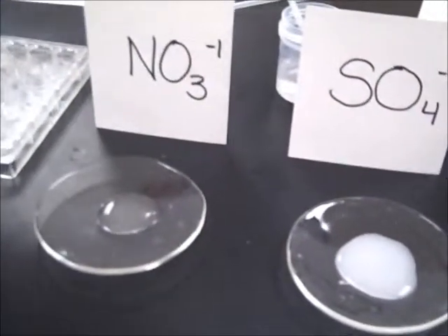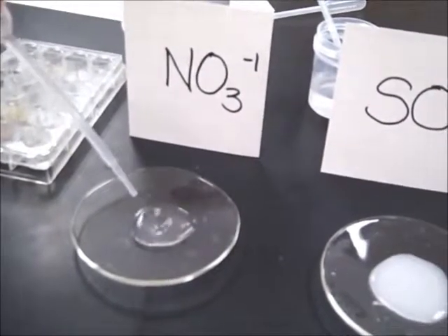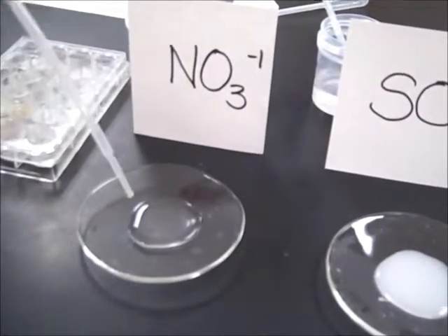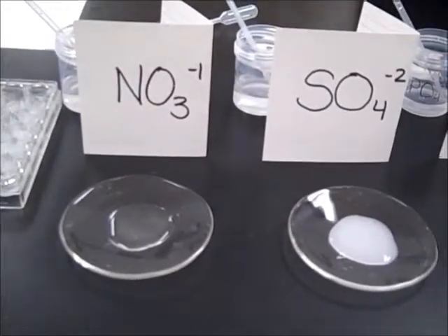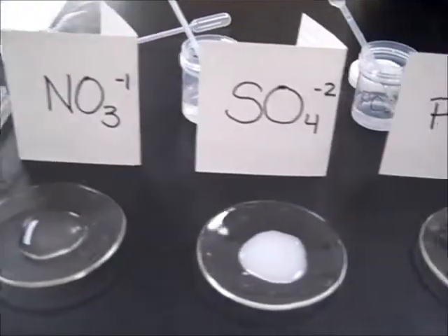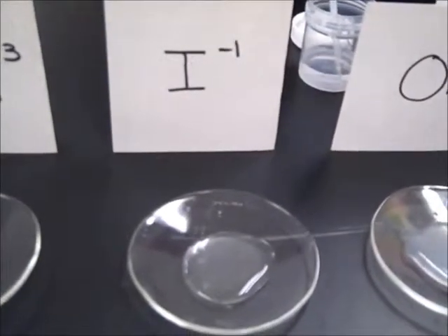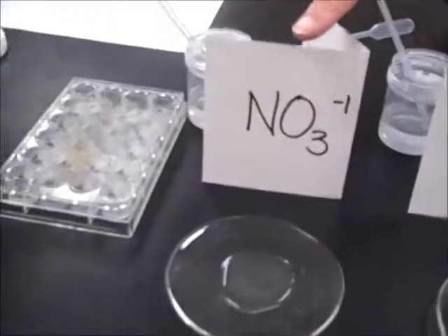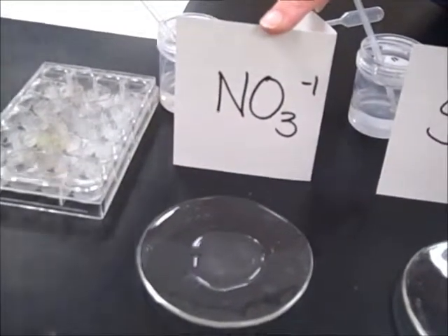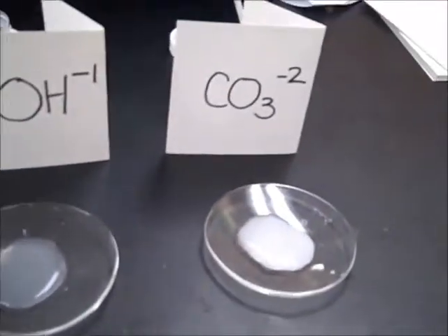And this is the strontium and the NO3. Big fat nothing. All right, so it looks like in this one too we have 2 non-reactions, but the rest of them are positive reactions. A non-reaction between strontium and the I-1 ion, and the other non-reaction between the strontium and the NO3-1 ion. The rest of them had reactions. That's kind of boring. I'm sorry, I couldn't entertain you more.